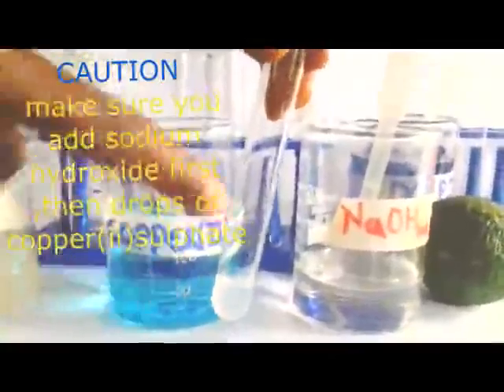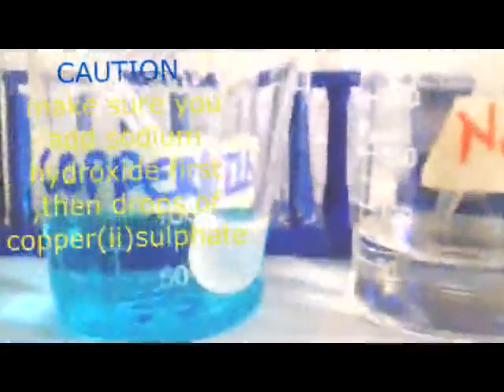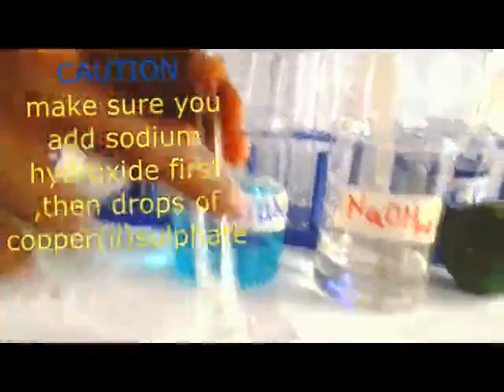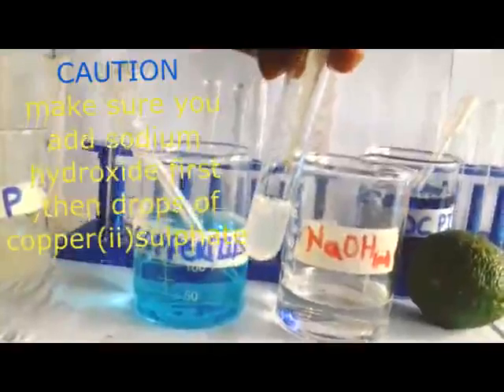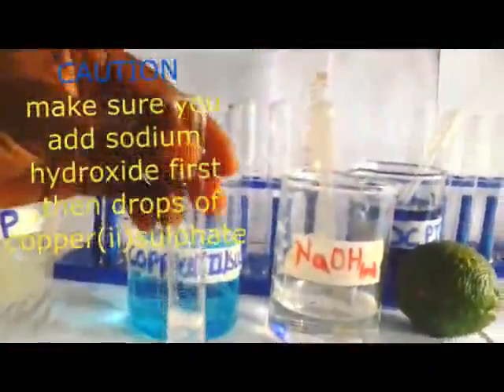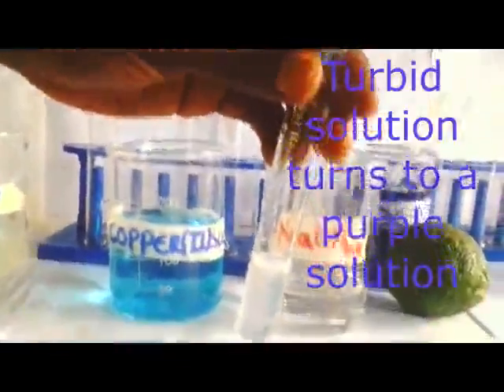Now this is our solution. When you look at the solution here, members, this solution is very turbid. Never be confused. So we can say turbid solution. To our turbid solution, we are going to add 1 cubic centimeter of sodium hydroxide. Remember I told you, for the Biuret test we first add sodium hydroxide. You have already set 1 cubic centimeter of the solution. Add 1 cubic centimeter of sodium hydroxide. Then you add drops, preferably 3 drops of copper II sulfate can be best. Then we do what? We shake.